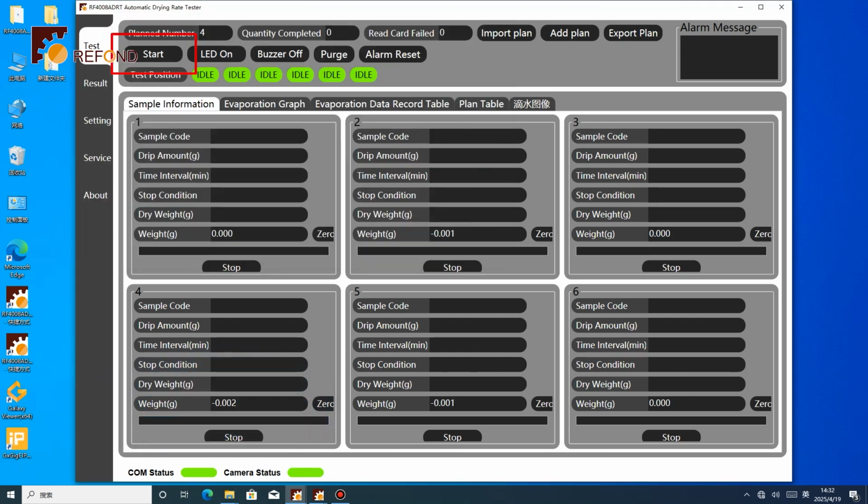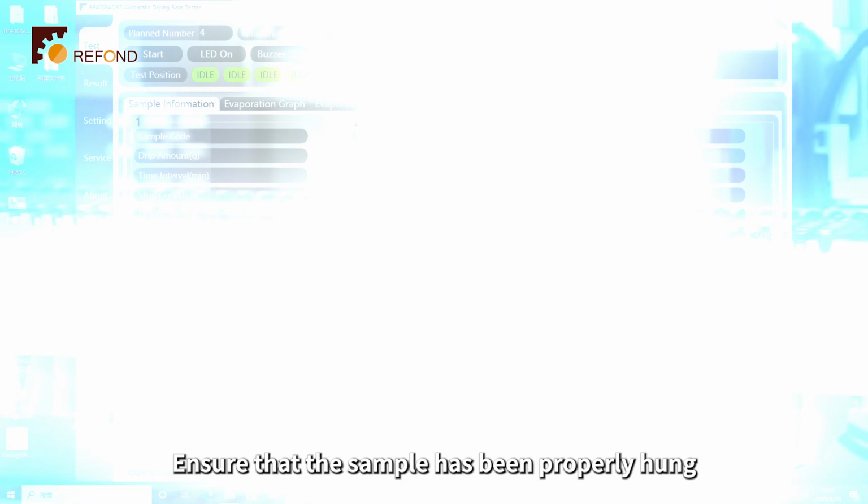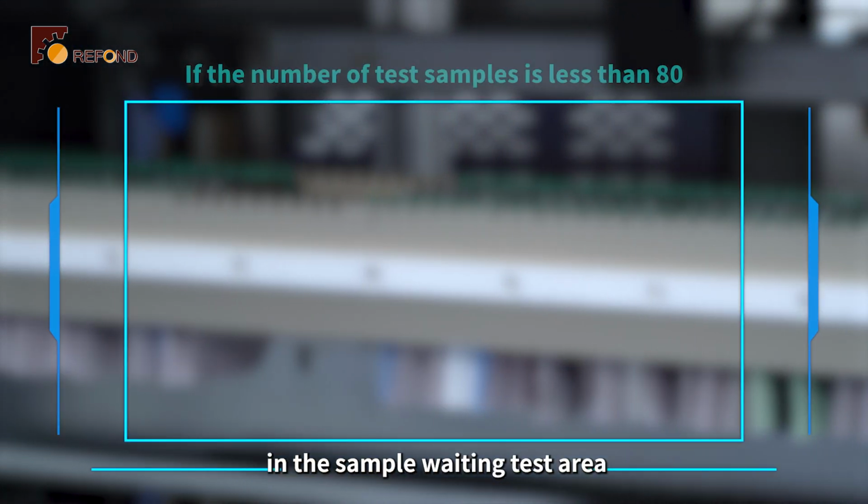Import plan. On the testing page, the first option is to click on Import Plan and select the plan file. Click Start to start testing. Ensure that the sample has been properly hung in the sample waiting test area.